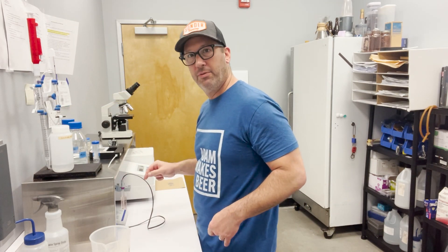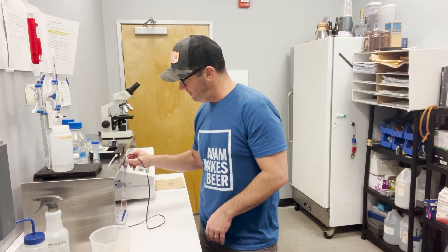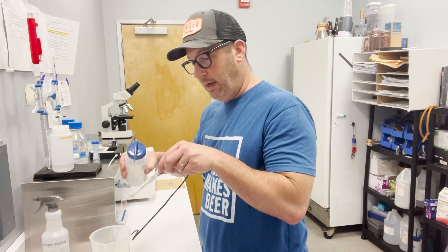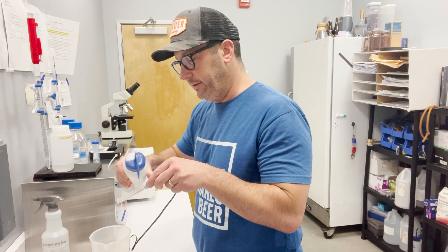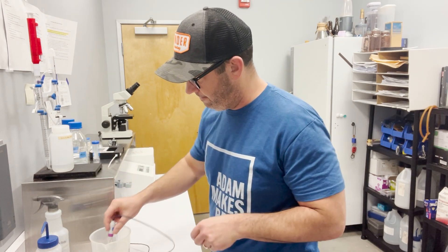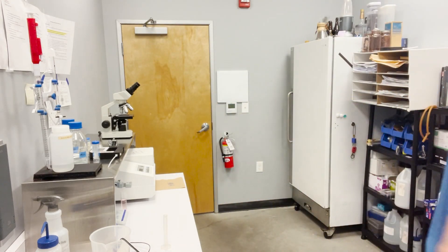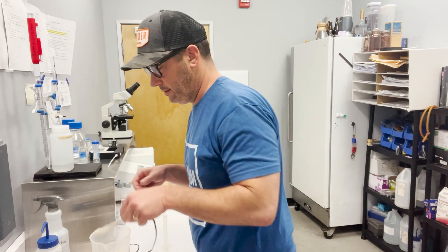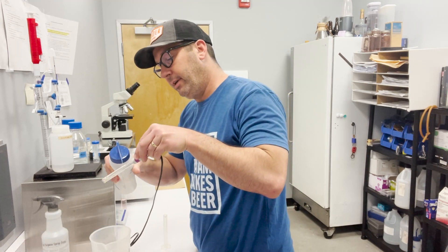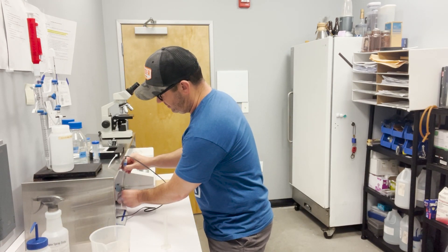We'll also need our pH. The pH meter is right tucked under the metal table here. I like to take it out of storage solution and give it a little rinse with distilled water before it goes into our sample. I'll wait for that reading. I have my pH reading. I'm going to rinse this pH meter with distilled and get it back into storage solution.